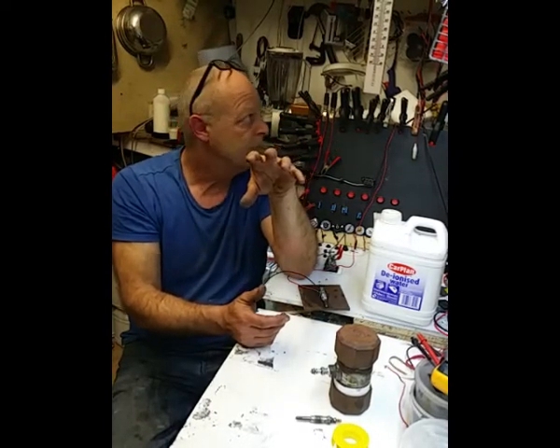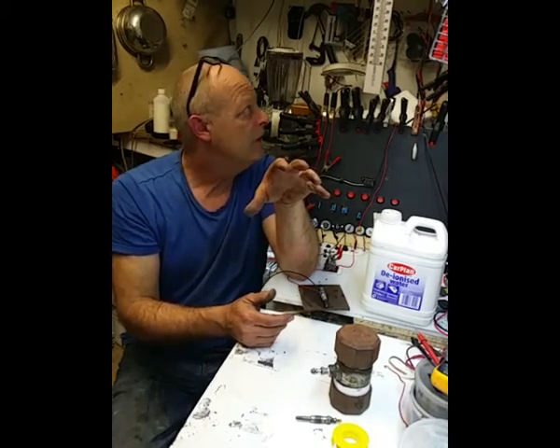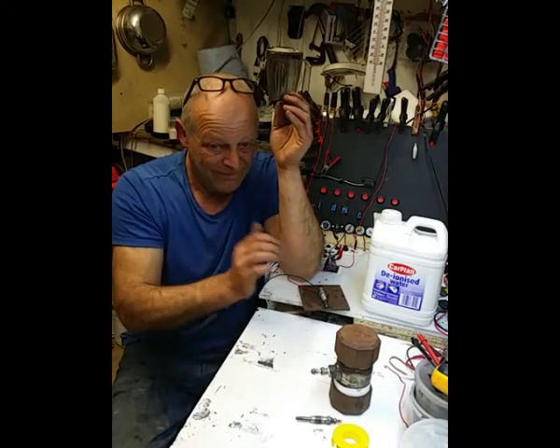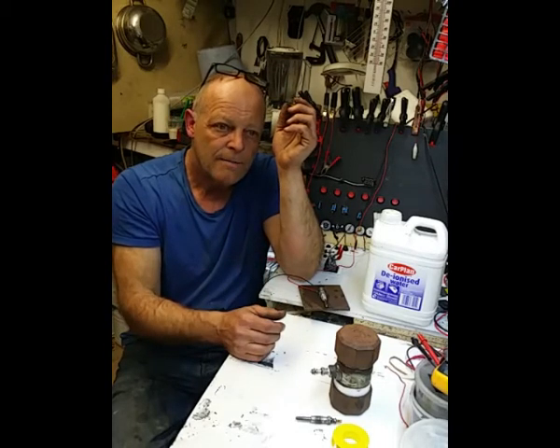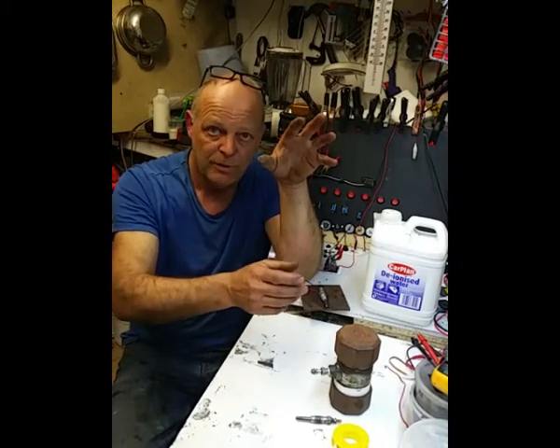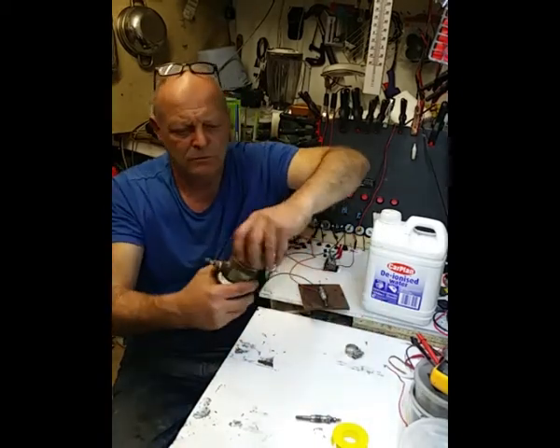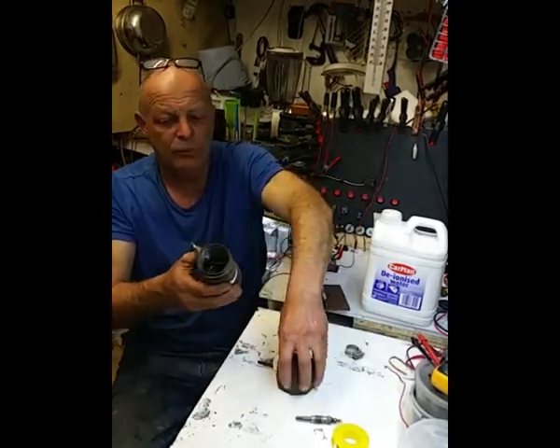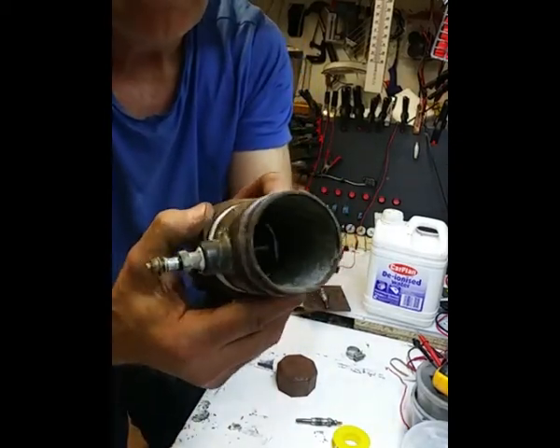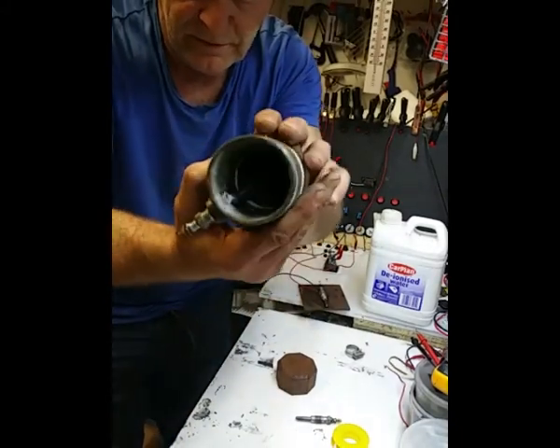What I'm going to do, it's at 1.2 volts at the moment, and it's drawing 1.3 amps. Now that is hot. What I'm going to do is move the camera a bit closer. We'll turn the current up, turn the volts up. These things actually glow red. Now this one, I'm hoping that you can see that inside there. I'll just move it around to get a better angle.